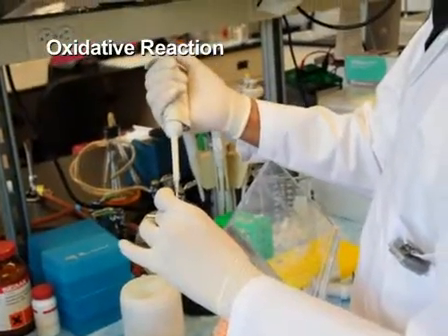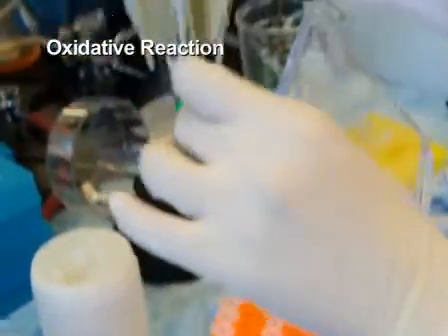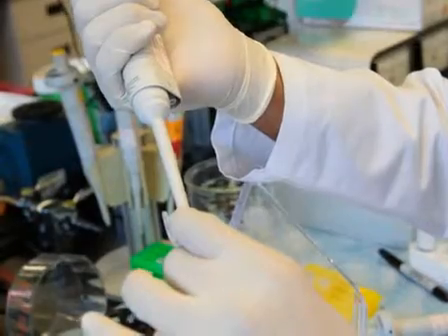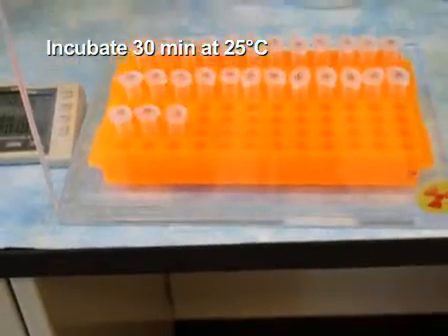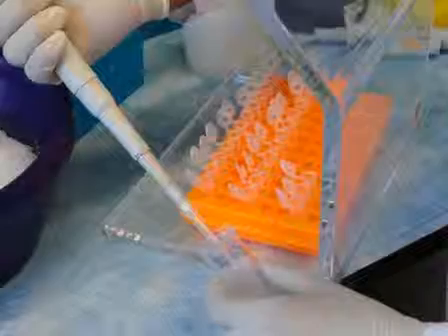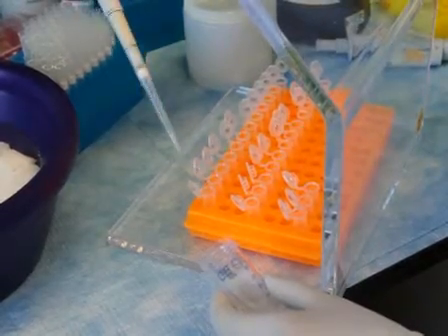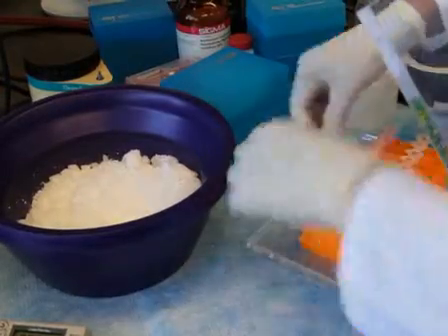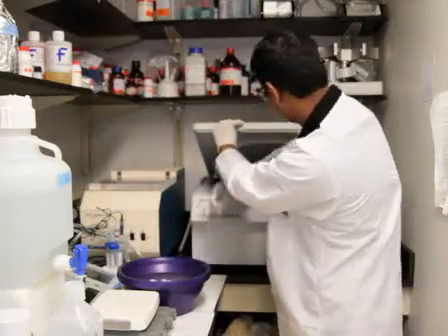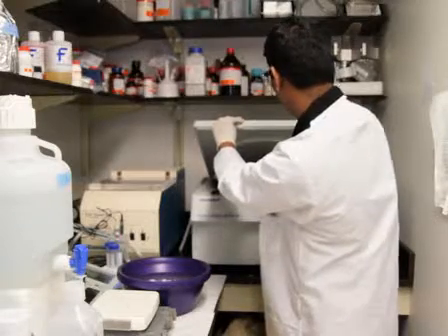As an alternative to the peroxidative reaction, the oxidative hydroxyl reaction can be performed by adding 5 microliters of the freshly prepared Fenton reaction mix to the samples. Incubate the oxidative reaction for 30 minutes at 25 degrees Celsius. Then add 300 microliters of pure cold ethanol to quench the reaction and mix by turning the tubes. Once again, precipitate, wash, and dry the pellet.